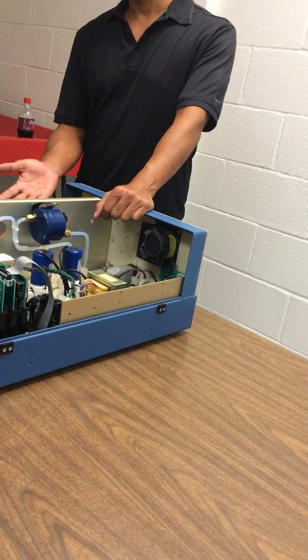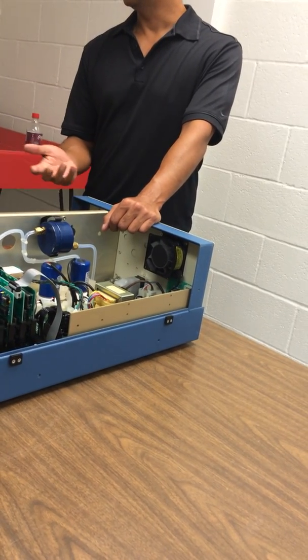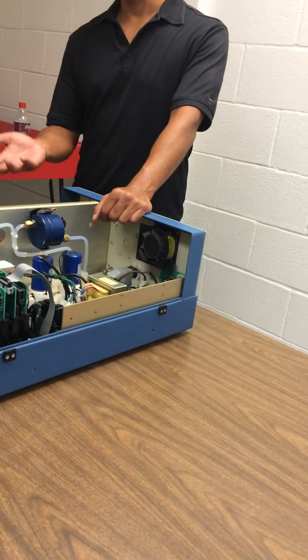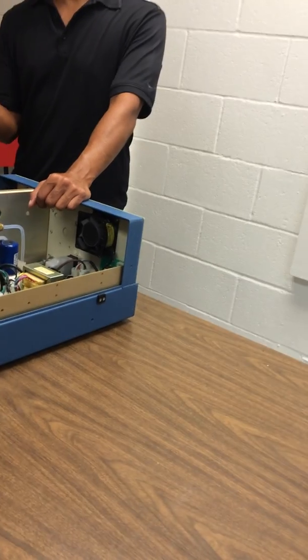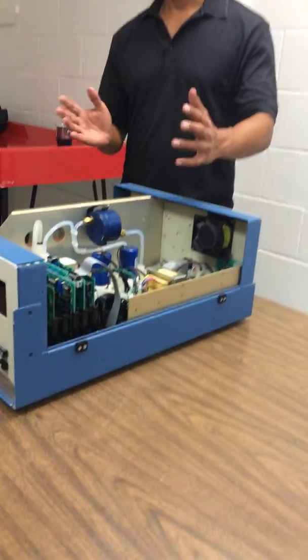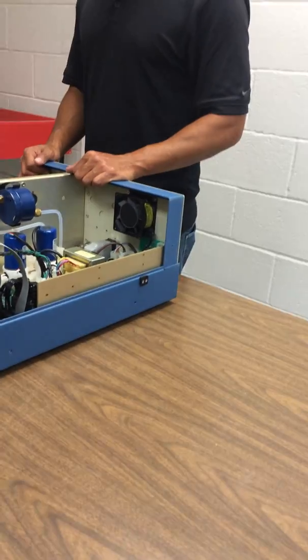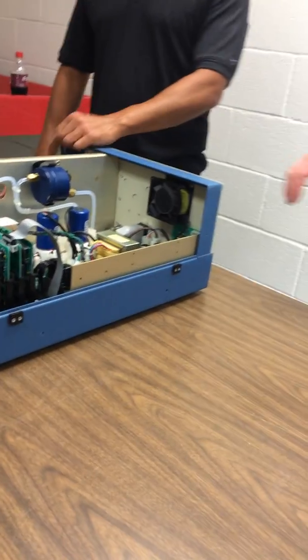Ozone absorbs light at 254 nanometers. And there are other things that absorb at that wavelength, like aromatic hydrocarbons and some other things. So that's the basic principle of everyone. The scrubber will selectively remove the ozone. What is the scrubber medium?